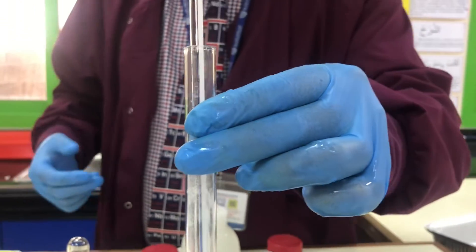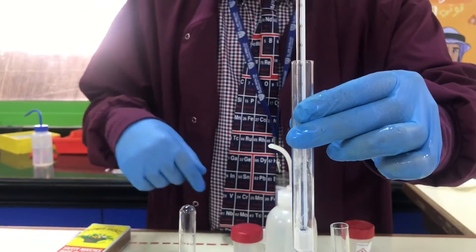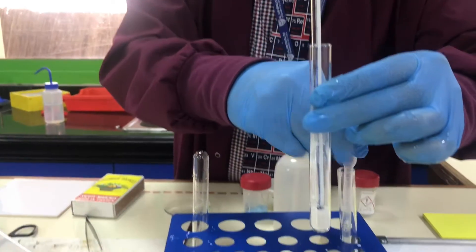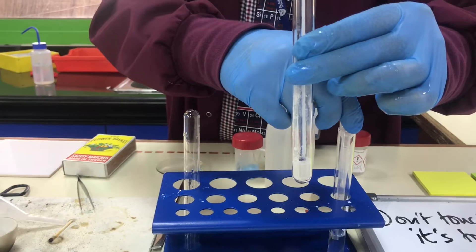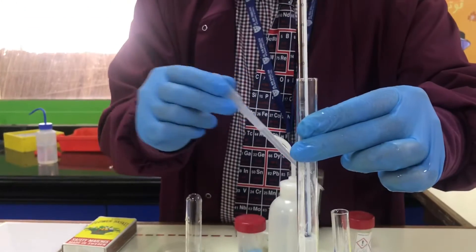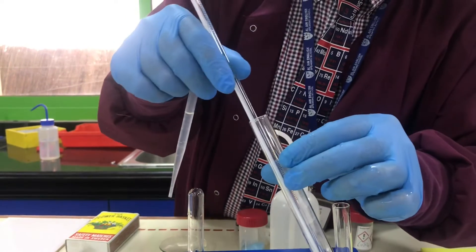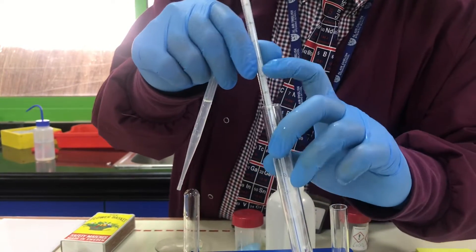I could leave it for a little longer but I'm not going to. I think we will need to go home as well eventually. So I'm just going to now add some water back in to it and I'm going to measure off the temperature as we do it.